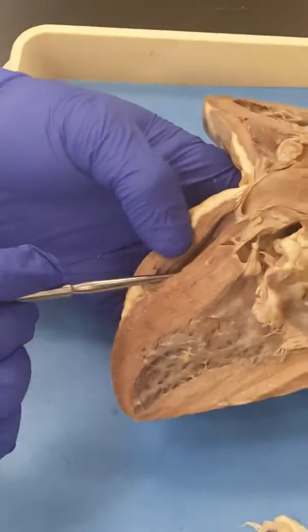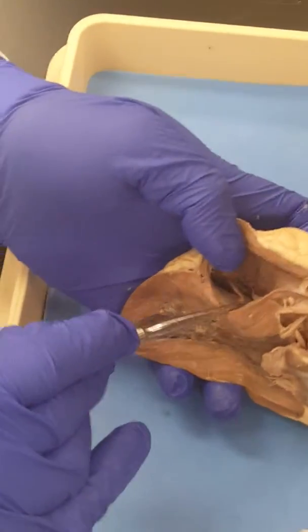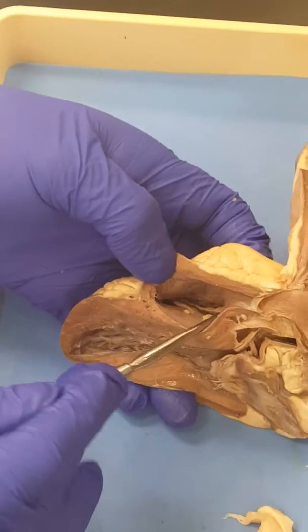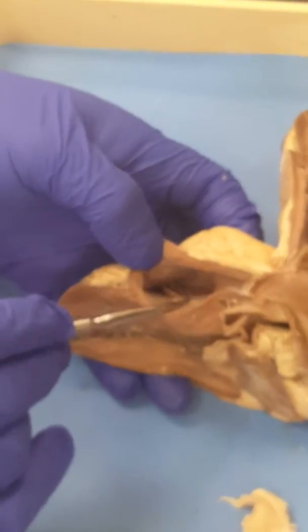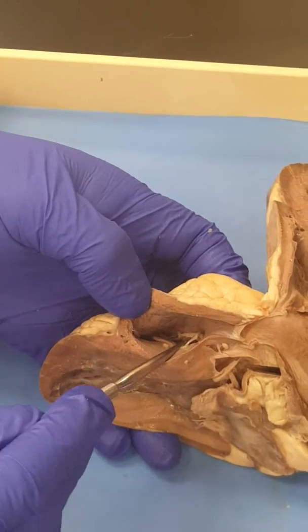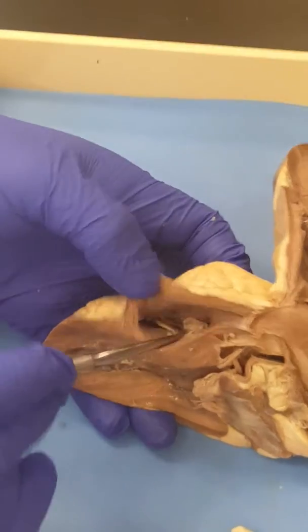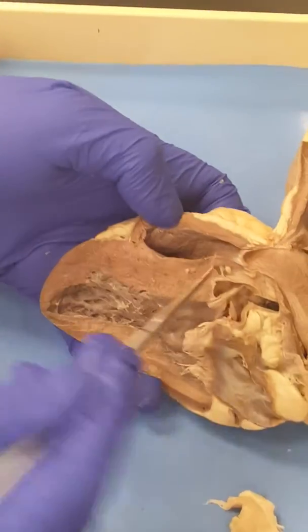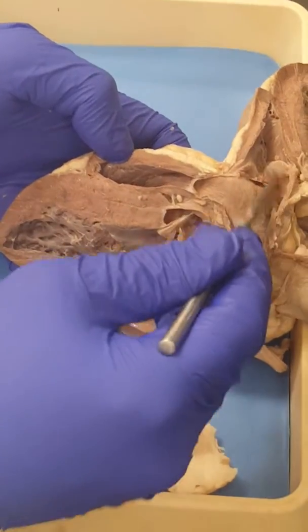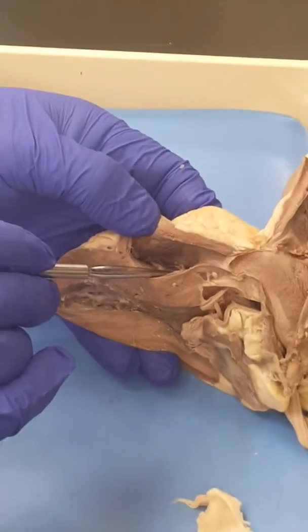Because of the way I cut mine, my tricuspid is very far. You see it? Look at it. It's going to be in there. So that's why I want several of you to cut hearts. So if I put a pin in there and I'm talking about what valve is that, you know to say tricuspid valve, right? You see it? You see the tricuspid over there? This one is the pulmonary semilunar valve. And this one in there is the tricuspid, okay?